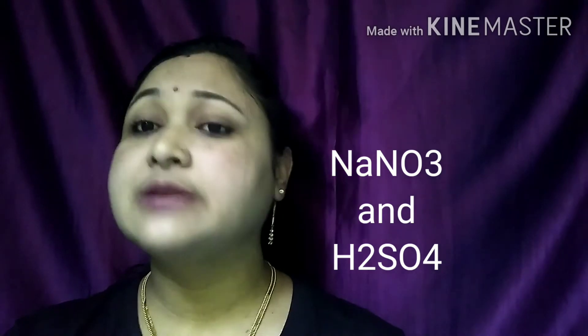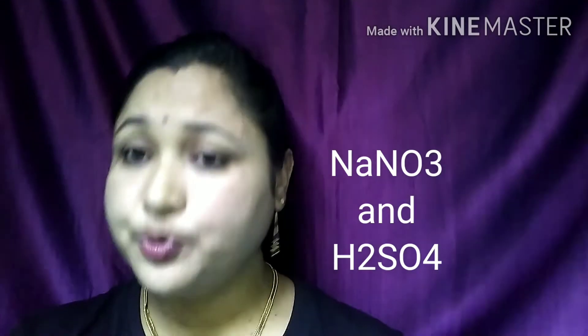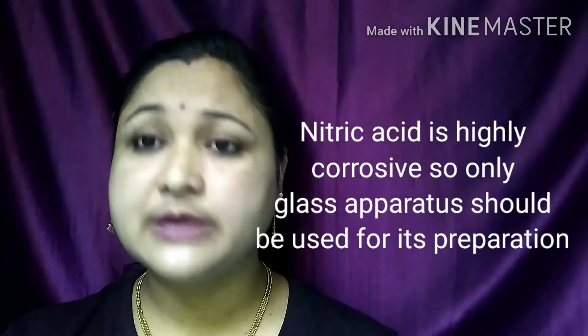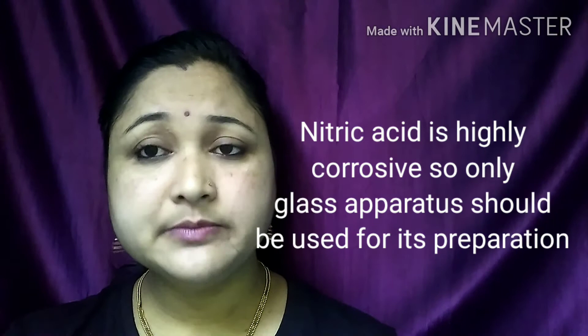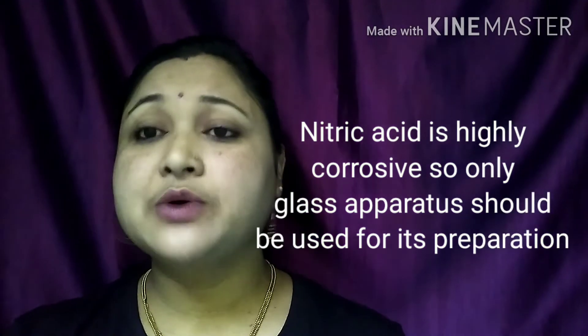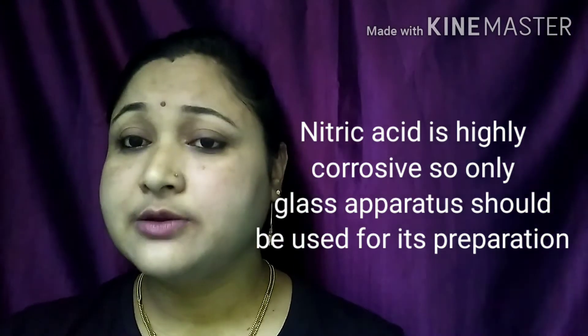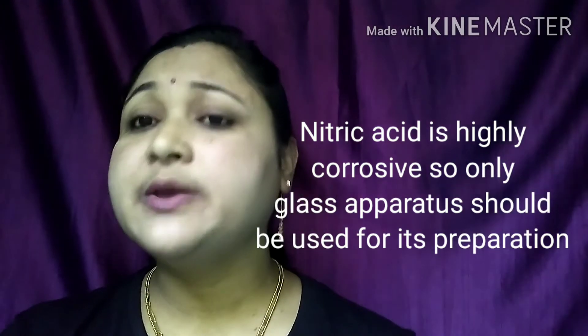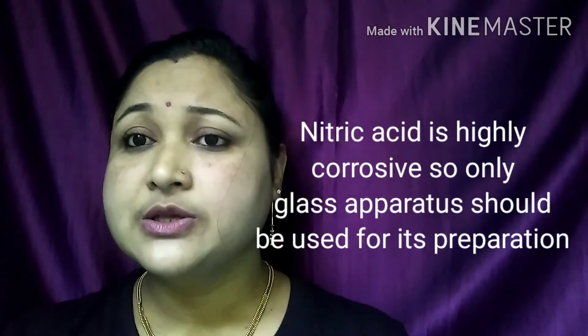An important precaution during nitric acid preparation: no material other than glass should be used, because nitric acid is highly corrosive and will corrode rubber corks used at the mouth of the flask. Therefore, all apparatus used during the preparation of nitric acid must be made of glass.